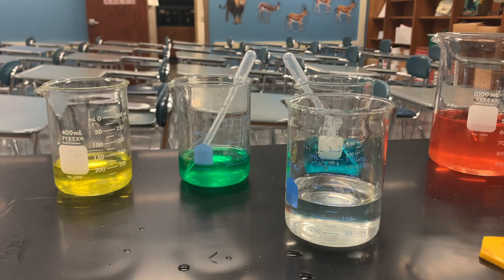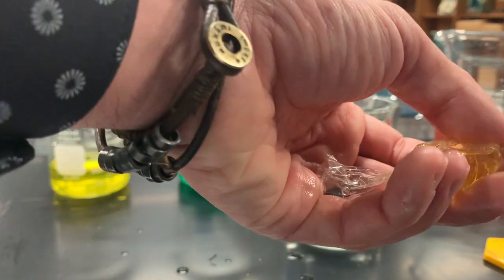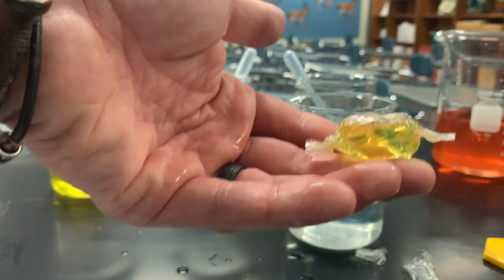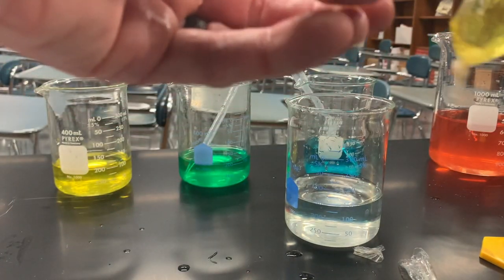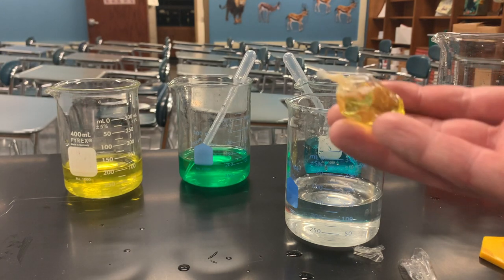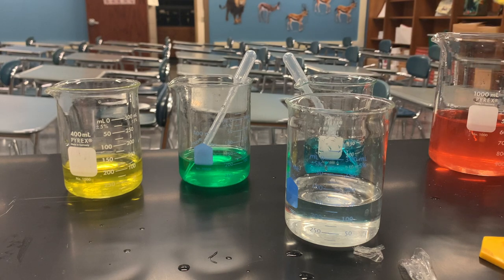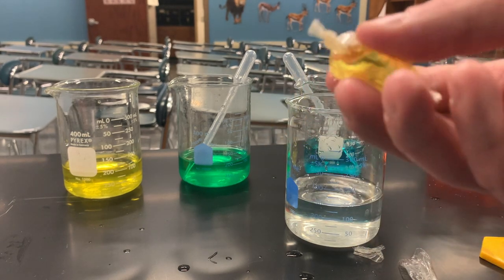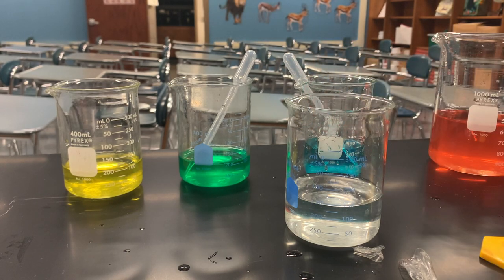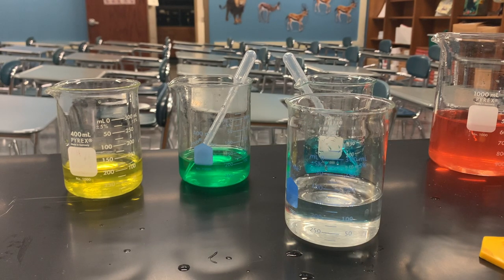I don't want all this excess because we're going to weigh these in a minute, so on the outside of the knots I'm just going to cut off the excess. Now I have my first little bubble of my yellow solution. What this dialysis tubing does is act as a cell — we have liquid inside the cell, and the tubing will act like the cell membrane. I'll do the other two off-camera and be back to show you our next steps.